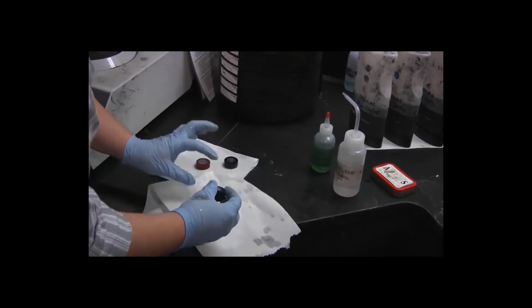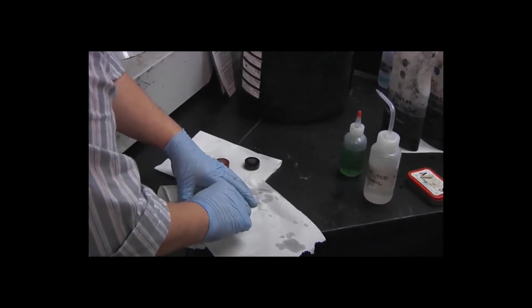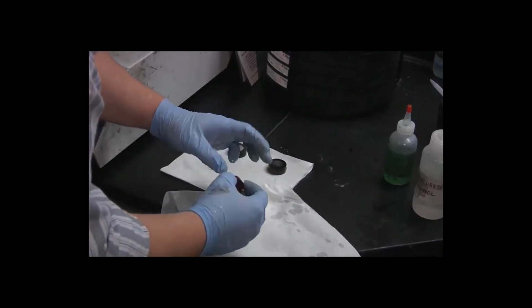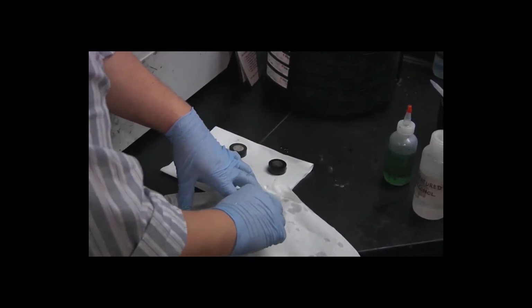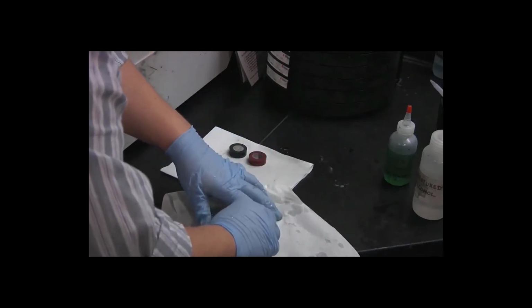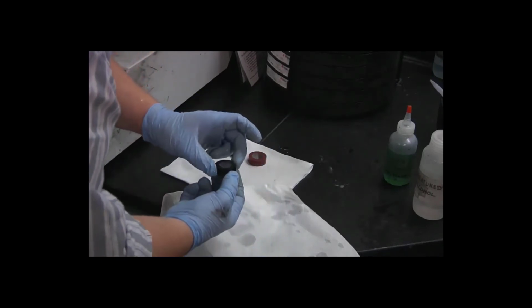And this time I'm going to dry them just by very gently wiping them across the surface of the paper towel rather than rubbing or patting, just to keep an even, gentle pressure on the surface.